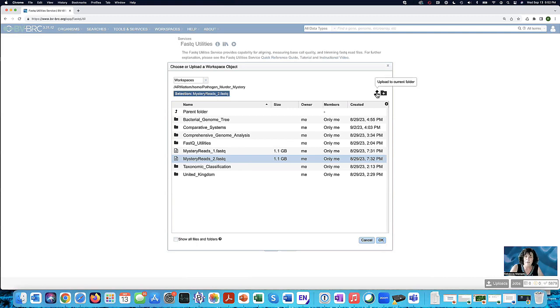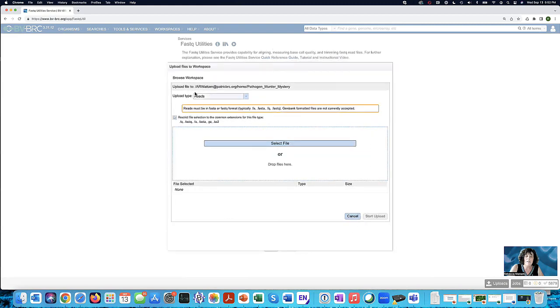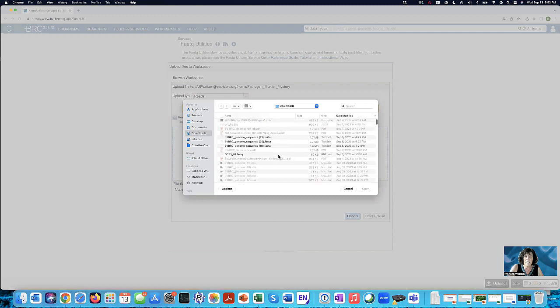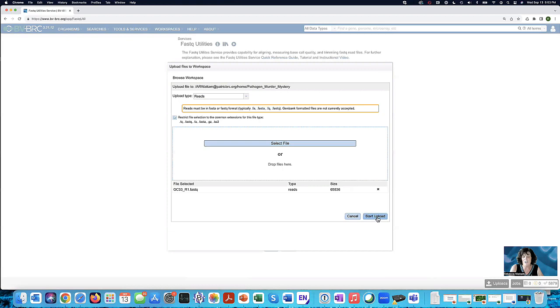You could click on the upload icon here and it's going to be looking in your computer. It's going to open a dialog box with your computer and look for read files. And those read files will have this ending at them. They're either in FASTA or FastQ format. So if I click on select file, it's opening that dialog box with my computer. And then look at this. It's only highlighting those files that are matching those endings, the FastQ or FASTA. So I could say, this is the one I want to upload, and I could start that upload.